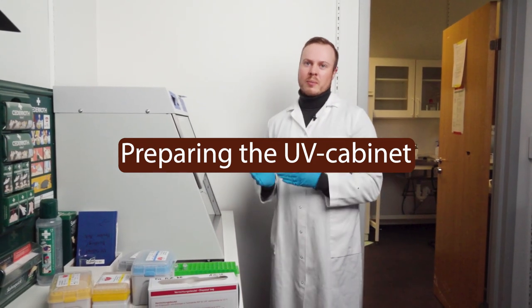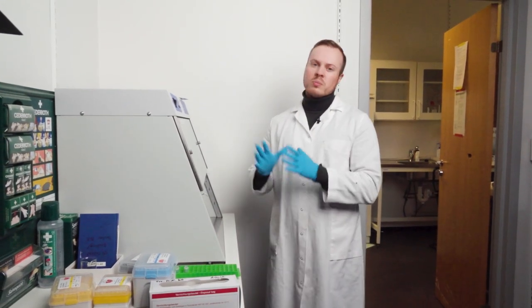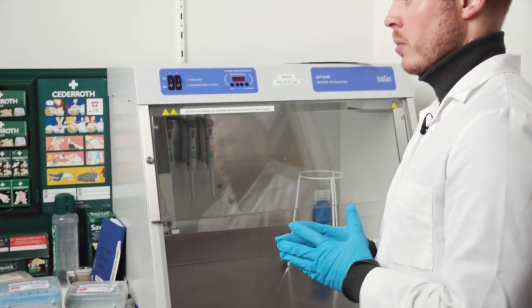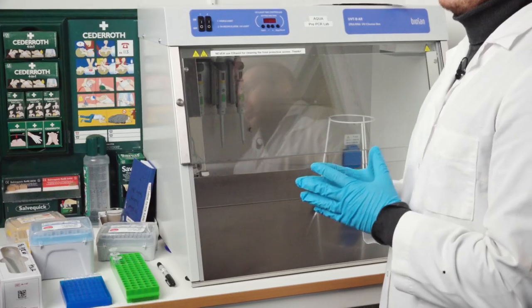So here we have the UV cabinet and this is the most important tool to make a sterile environment when we are working with PCRs, especially when we come to bacteria that has a very high contamination risk.